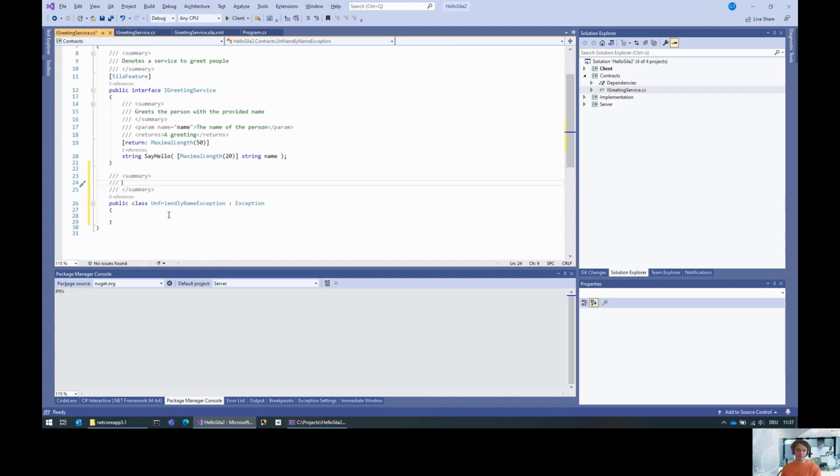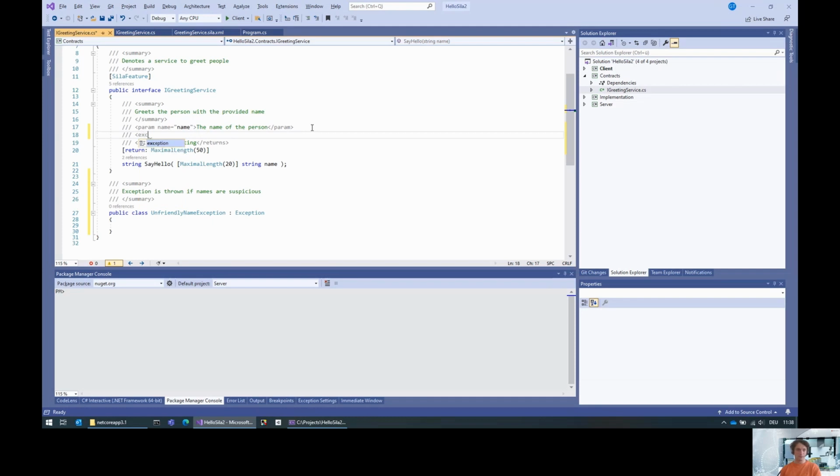And of course, the exception is thrown if names are suspicious. And as good coders, we need to document that the say hello command method can actually raise this exception. So just use the exception reference. This is an unfriendly name exception. And that is already it for the interface specification.